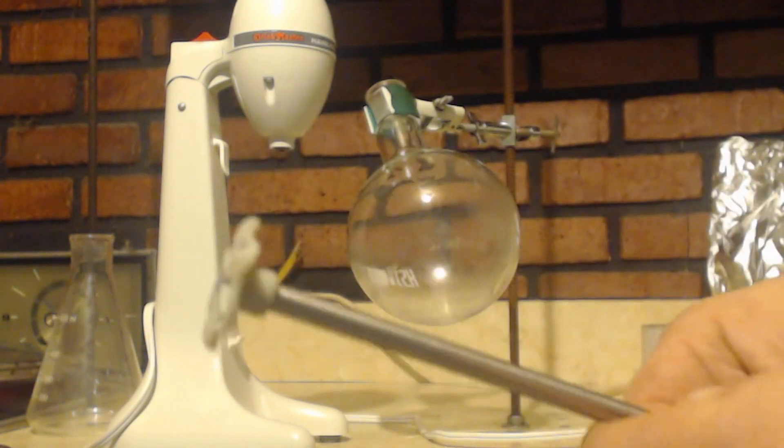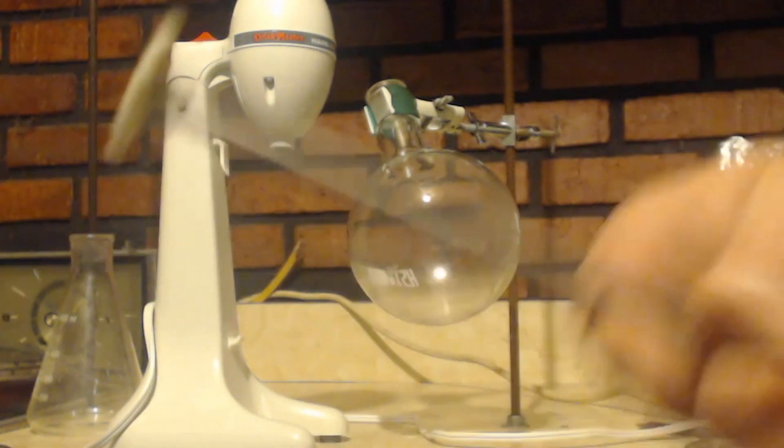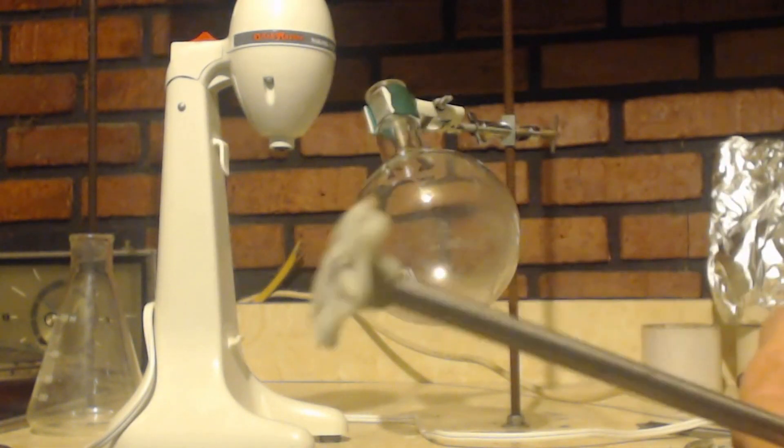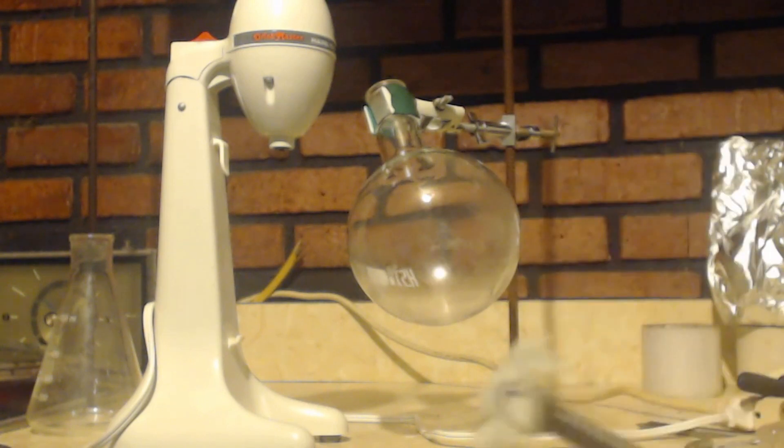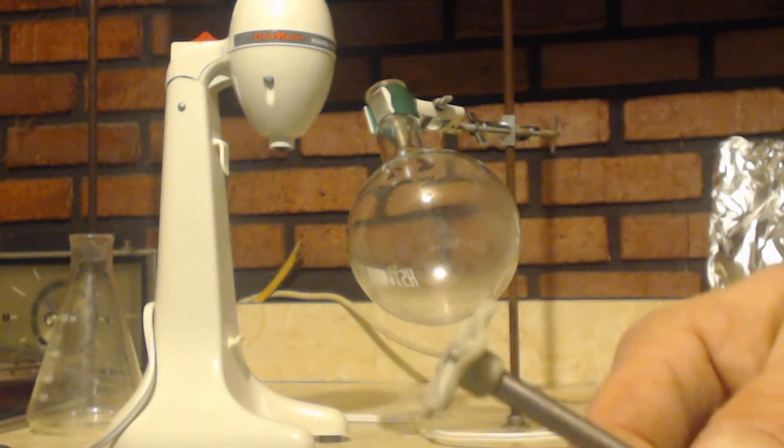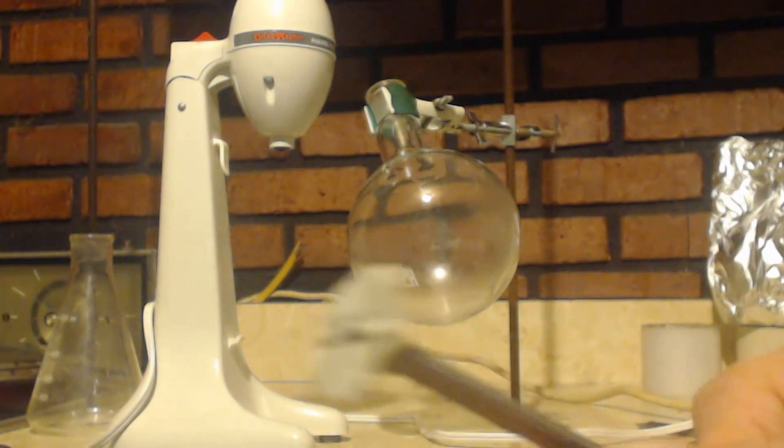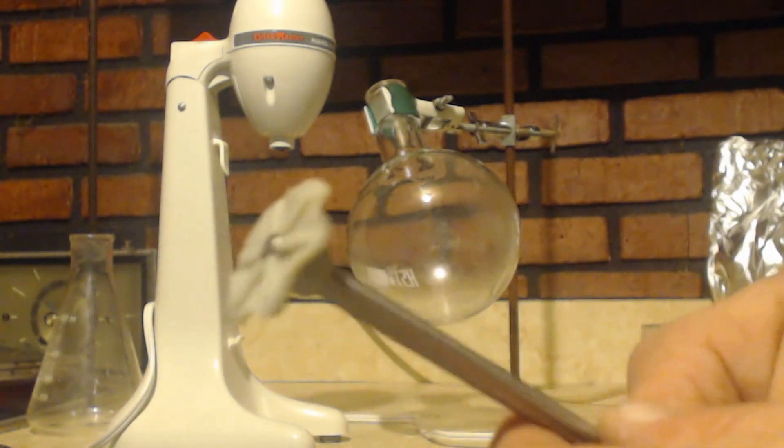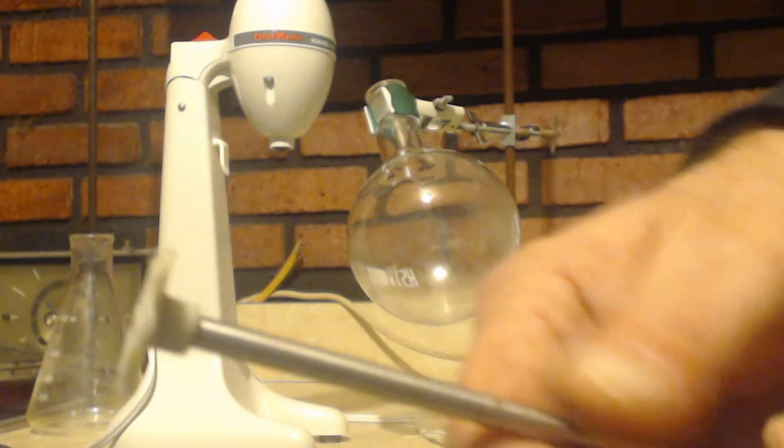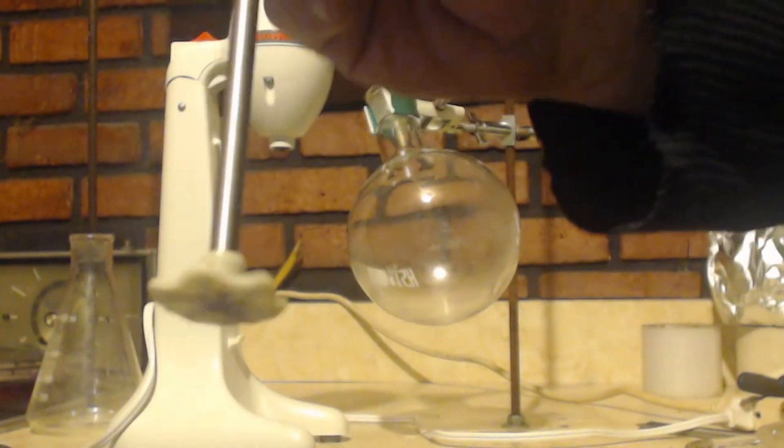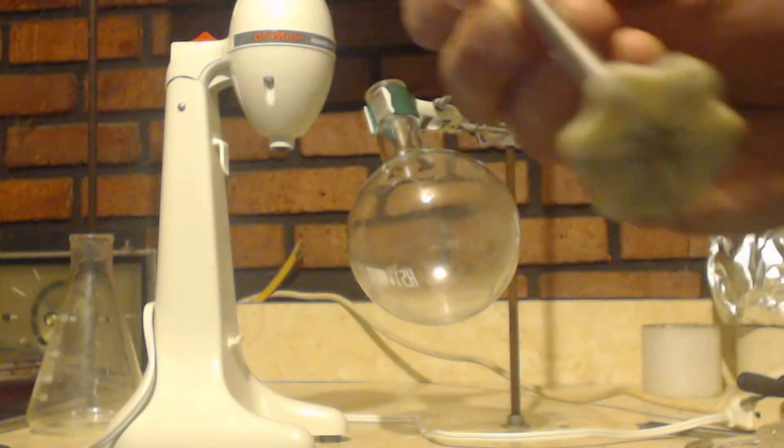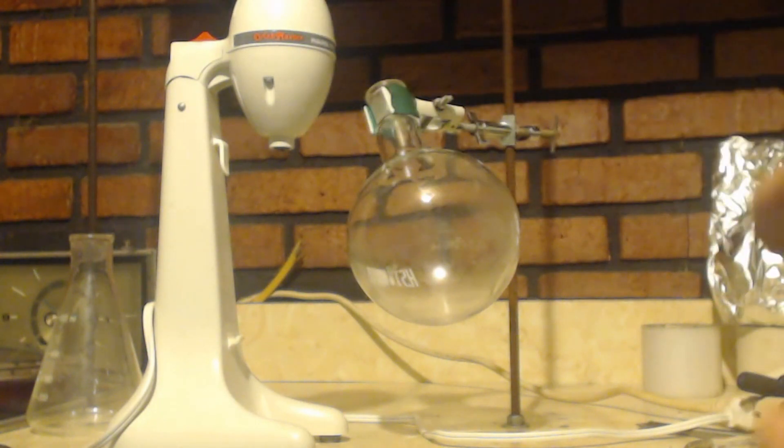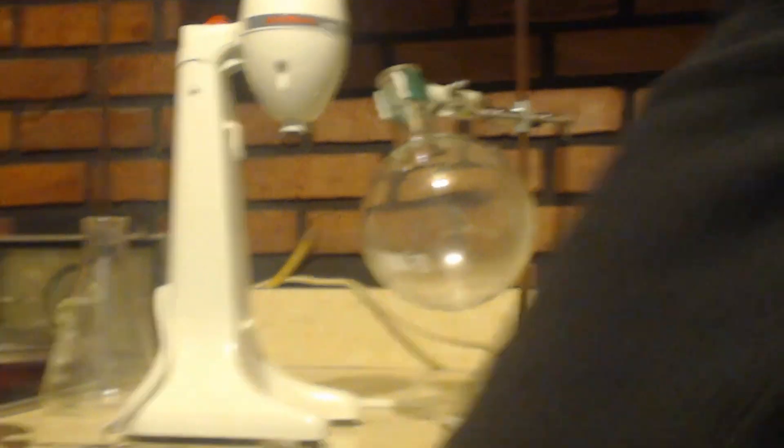Maybe you could use that on this. You could dip this in and let it dry and maybe it won't be reactive. Or maybe you could use, because the stir bars are coated with teflon, you can buy teflon paint and paint this, coat it with teflon paint, and that might make it not be corrosive.